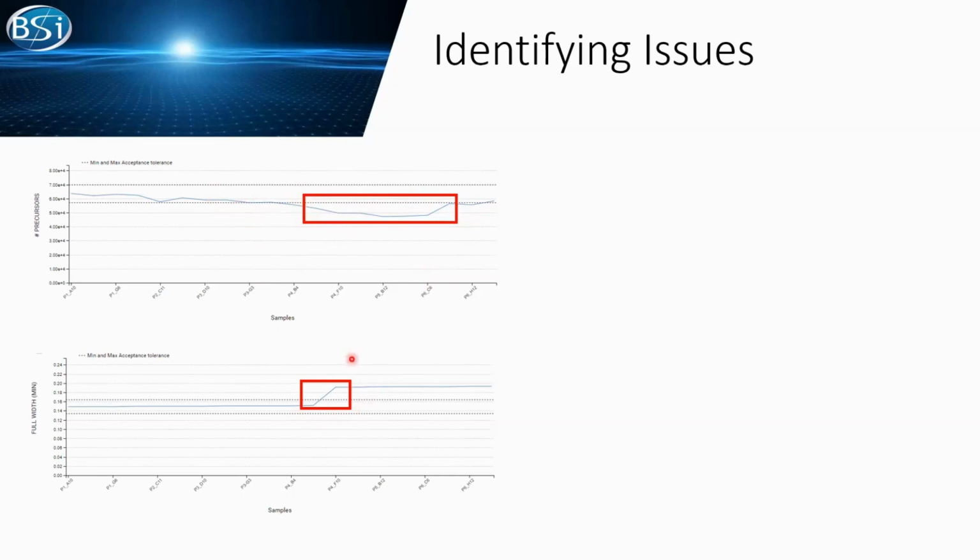And in here, you can see in the plate 4 run, we have a clear jump in the full width of our peaks. Therefore, all right, now you have a very clear view. Okay, so we have issues on the LC. At least we are going to look in that direction.